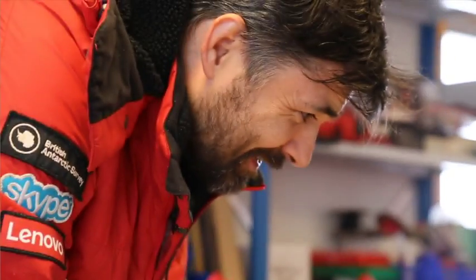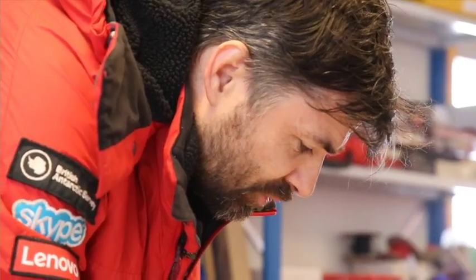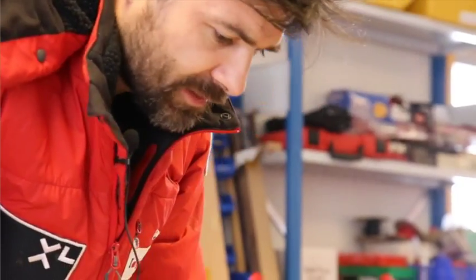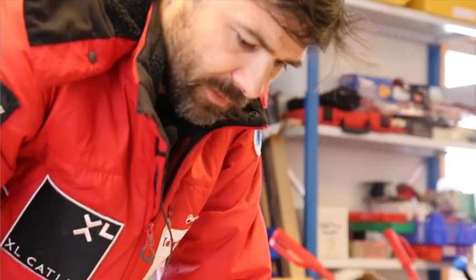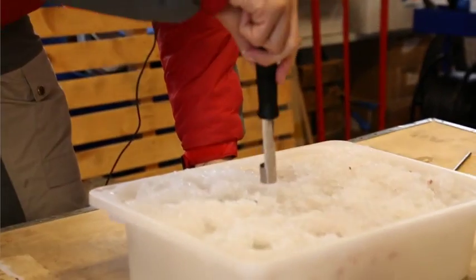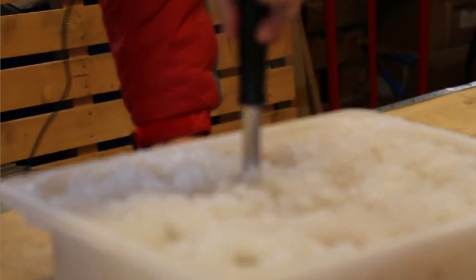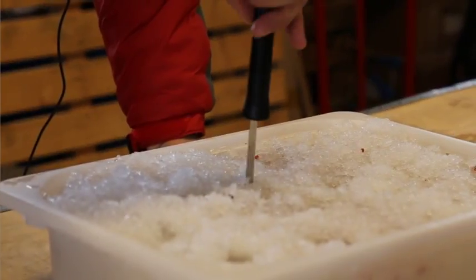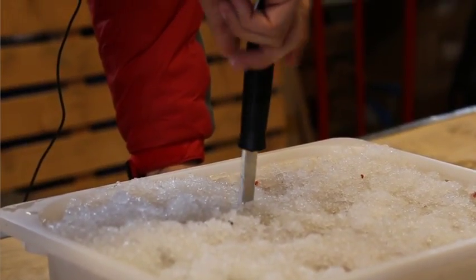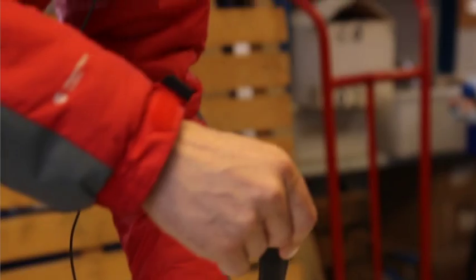So 14, someone making a note of this. 14 plus 20 plus 0. I'm going to do one more. And I've done one here, one here, one here. Let's go down in the middle here. And this is what scientists are doing. They are making these cores through the ice and trying to see.